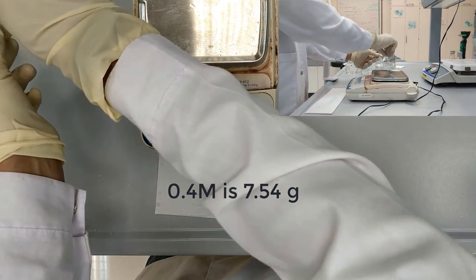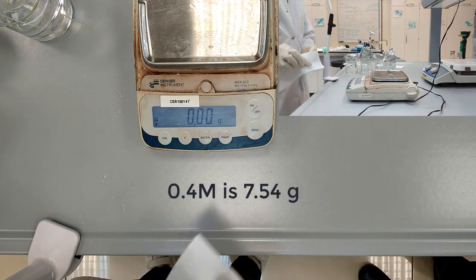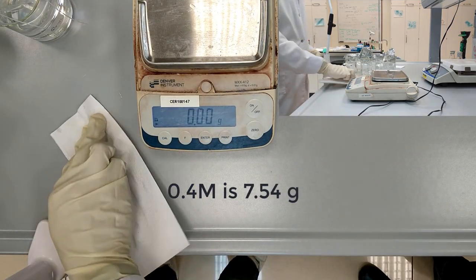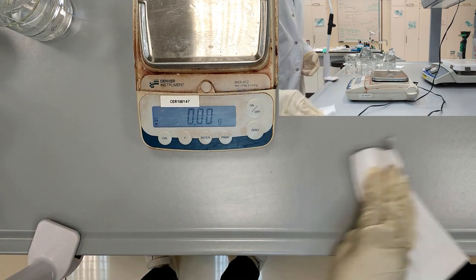So now you need to put the results of the experiment into the table and draw a graph about the change of mass for these dialysis tubes.